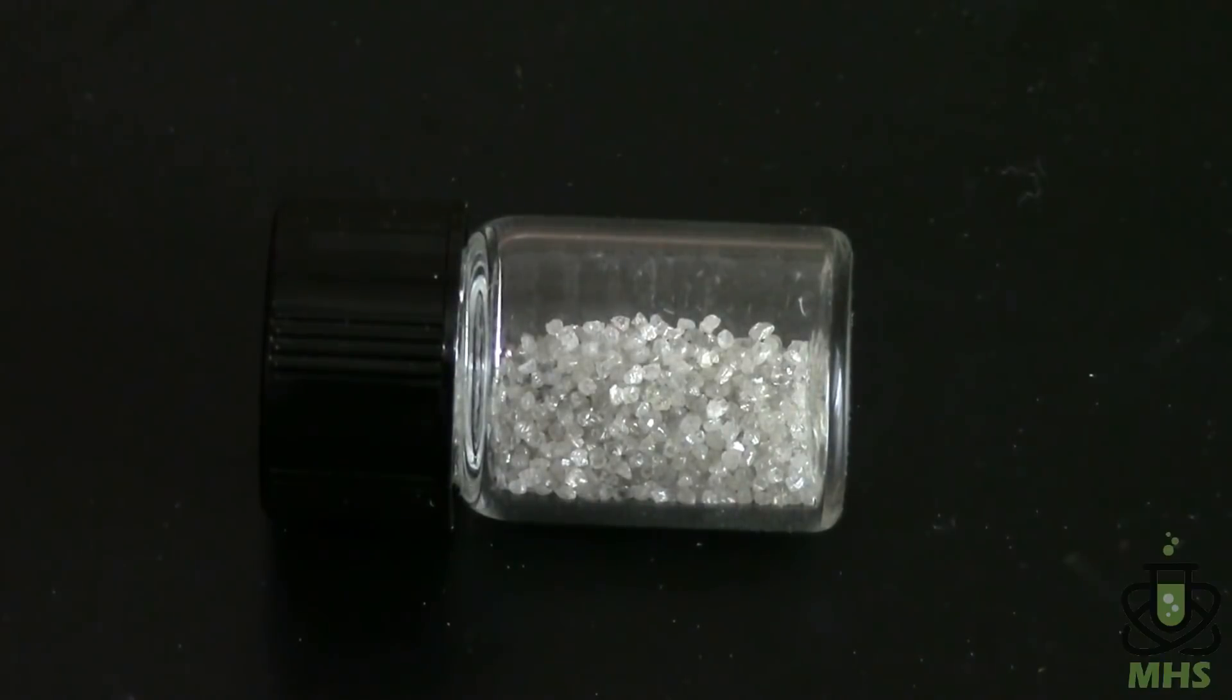And here they are again. This is my little vial of diamonds that I bought on eBay a while back. And we're going to be taking a small portion of those and burning them.